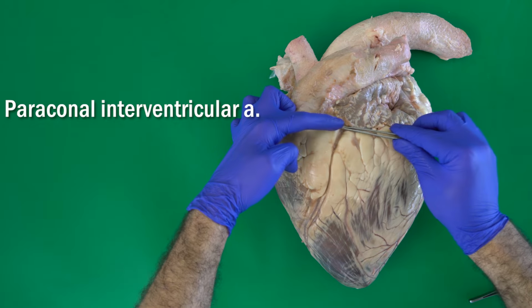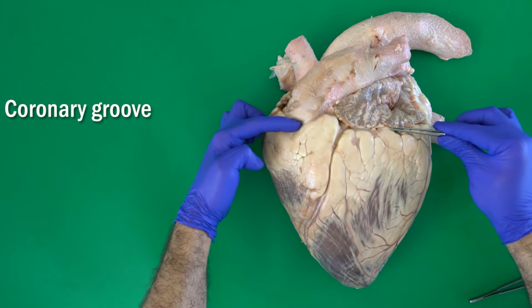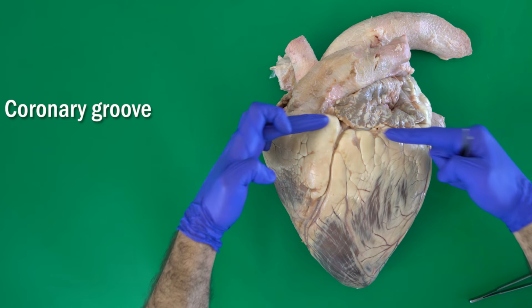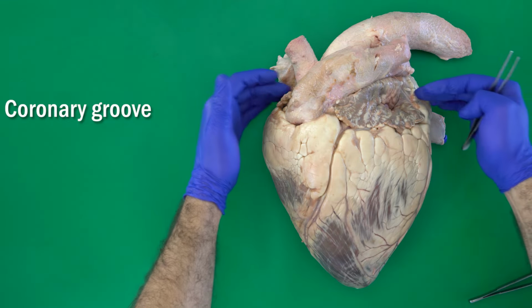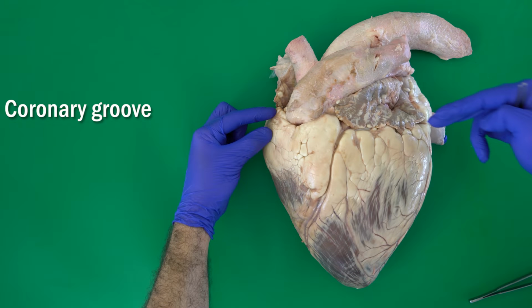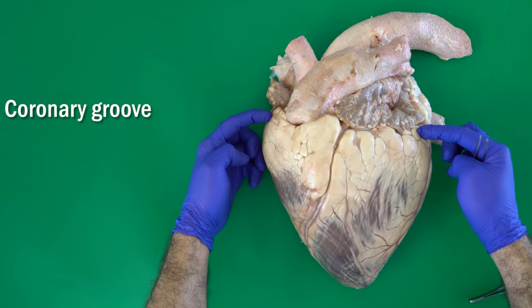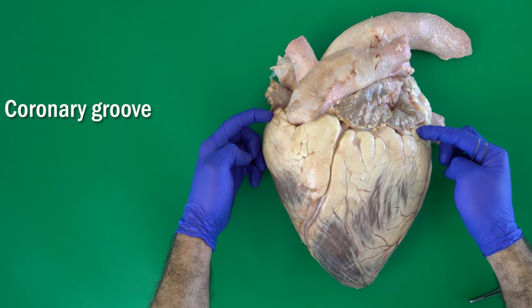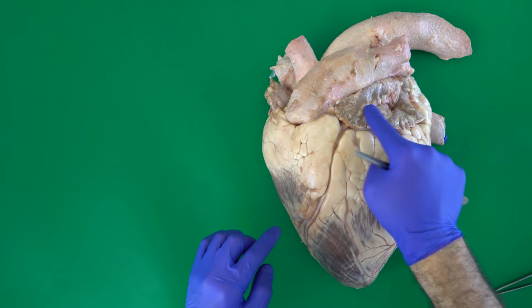At this level, we have another groove called the coronary groove. This is the coronary groove, which is located exactly at the level between the two ventricles and two atria. Inside it, we can find the left and the right coronary arteries.